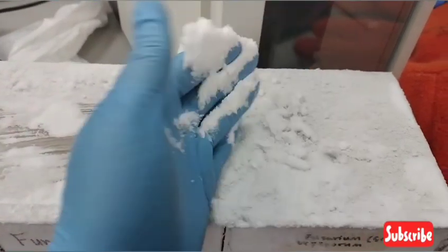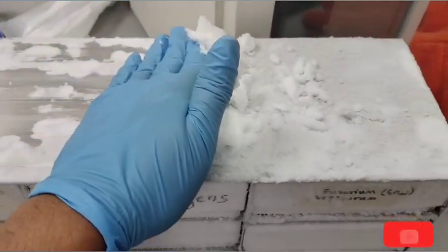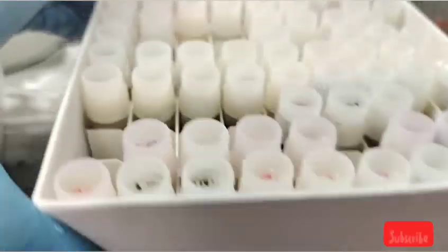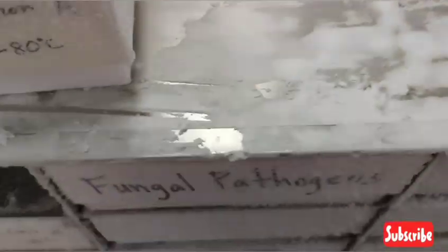So cold. Oh my god, look at that. Okay, I probably should not do that because then I'm going to have a mess that I'll have to clean up. That wasn't a good idea. Nope, that's not what I want.